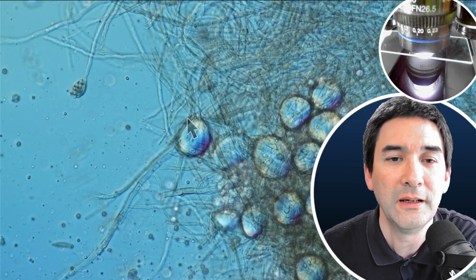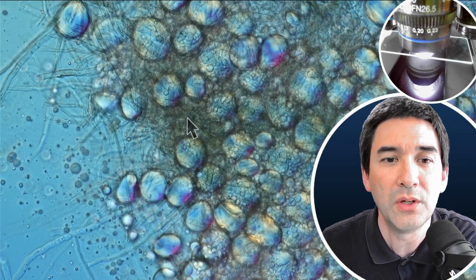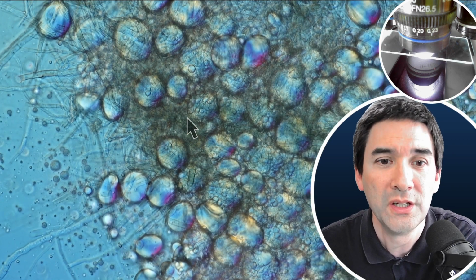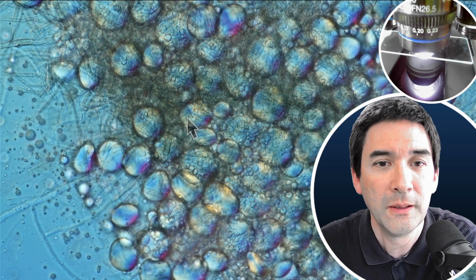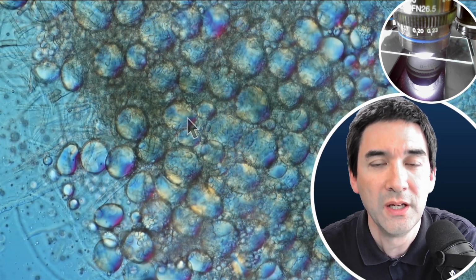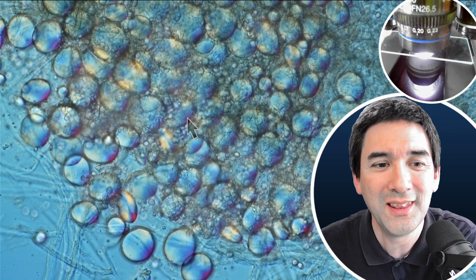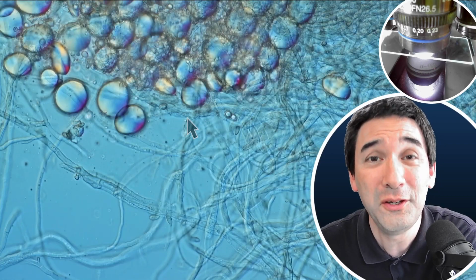Honestly, what I think has happened here is that when I took a small sample from the bread, I accidentally also scratched off a little bit from the surface of the bread, and this might actually not be from the fungus itself. Well, I think as you can see, there are always interesting things to discover. And I just wanted to share this with you today.